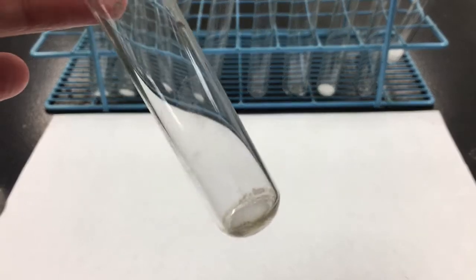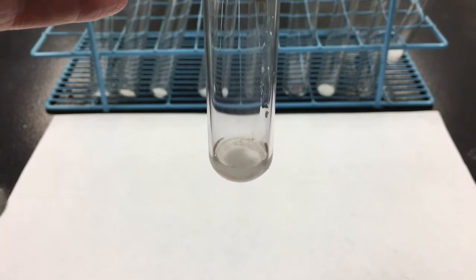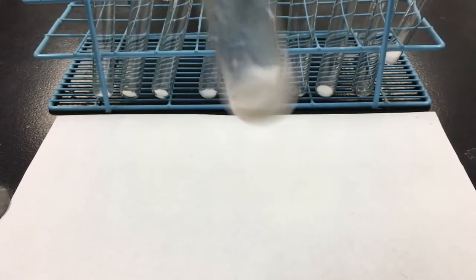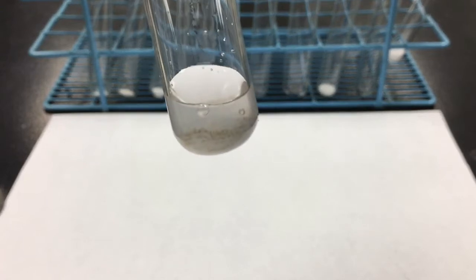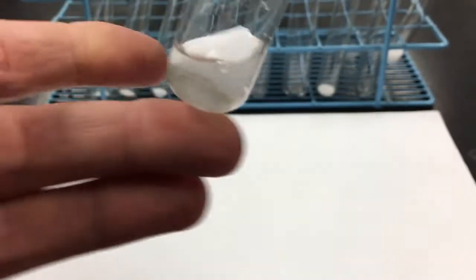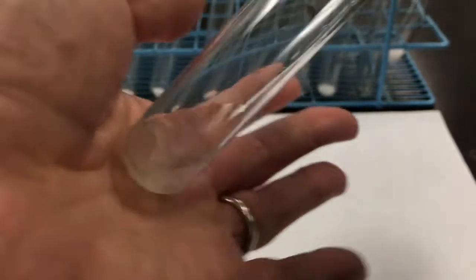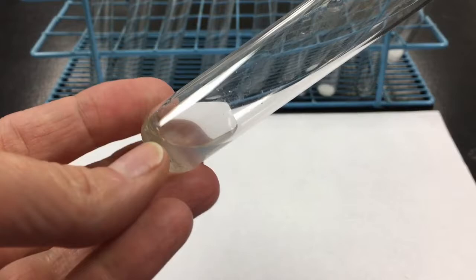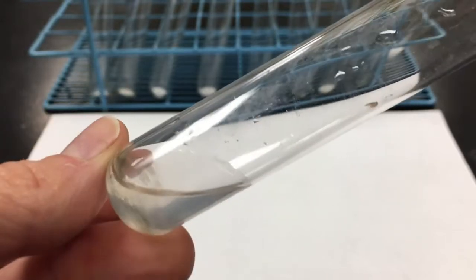So, experiment 1 uses solid A, which is already in the test tube, and liquid 1, which I will add now. And kind of give it a bit of a shake. I'm not really seeing anything. I'm not hearing anything. I don't feel anything. I don't smell anything. I do see there's still some solid left at the bottom of the test tube.